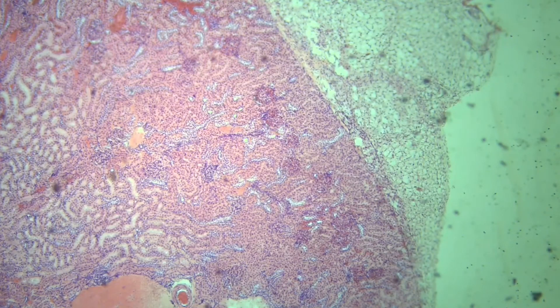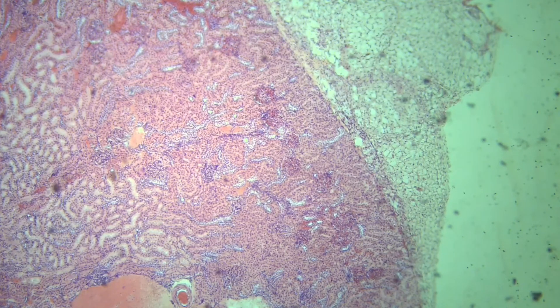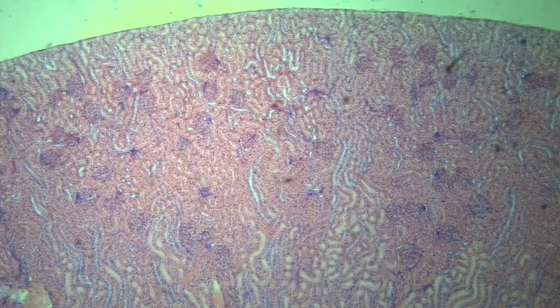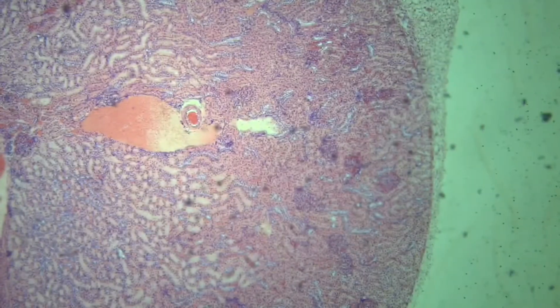At low magnification of the microscope, you can see three parts. Capsule – it is an outermost covering of fibrous tissue. Cortex – it is a reddish-brown layer of tissue immediately below the capsule. Medulla – it is the innermost, lightly stained part of the kidney.